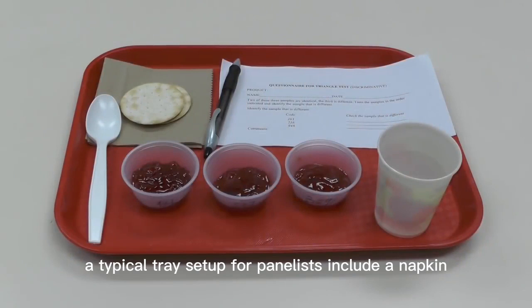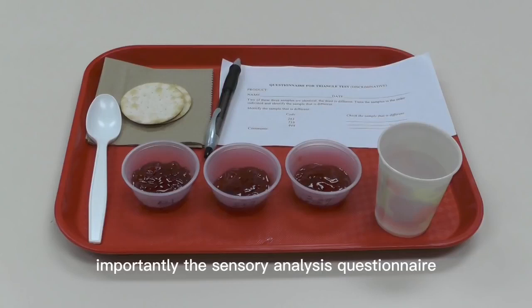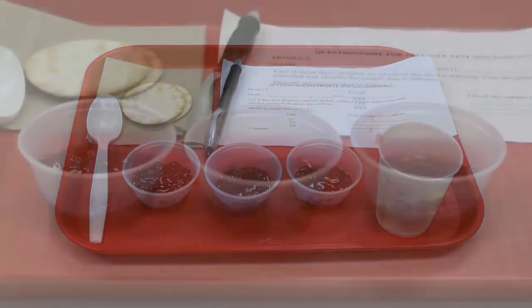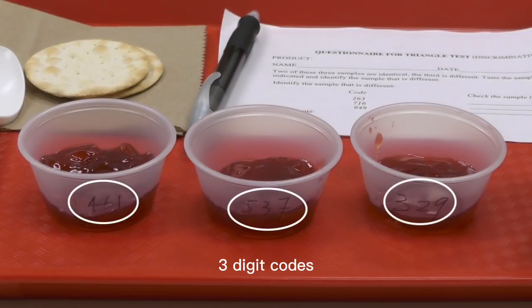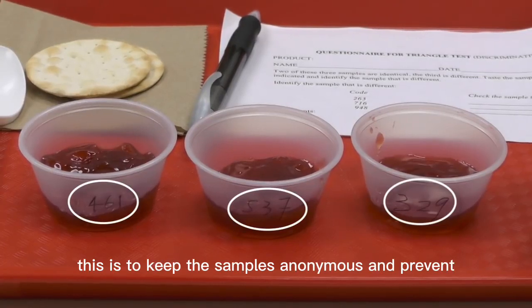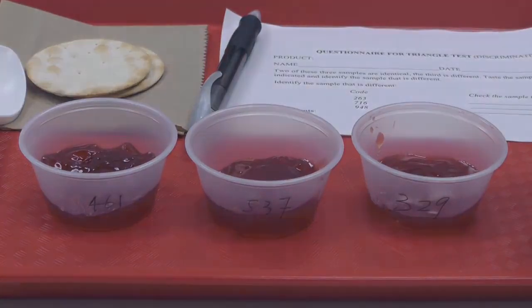A typical tray setup for panelists includes a napkin, utensils if required, a cup of water, some crackers for cleansing the palate, food samples of equal volume in individual serving containers, and last but most importantly, the sensory analysis questionnaire along with a pen. The serving containers should be labeled with random 3-digit codes. This is to keep the samples anonymous and prevent bias when panelists evaluate the samples.